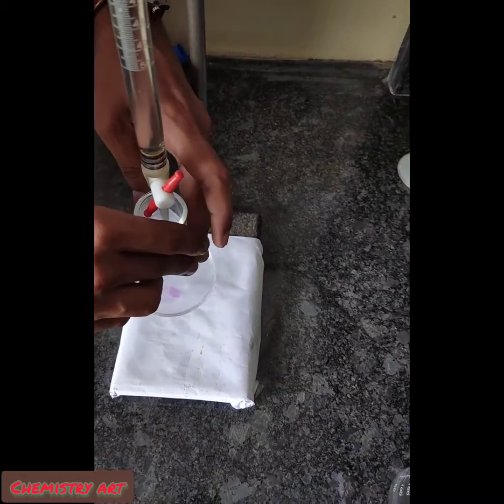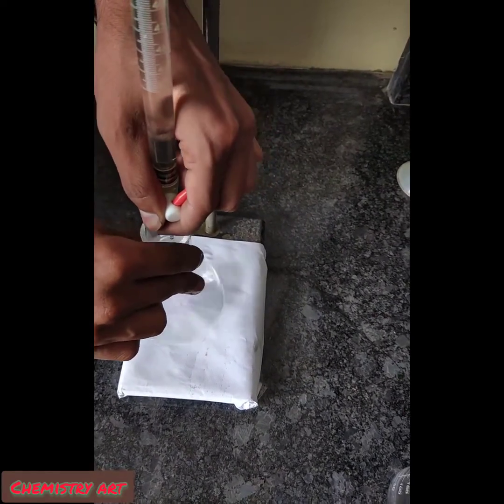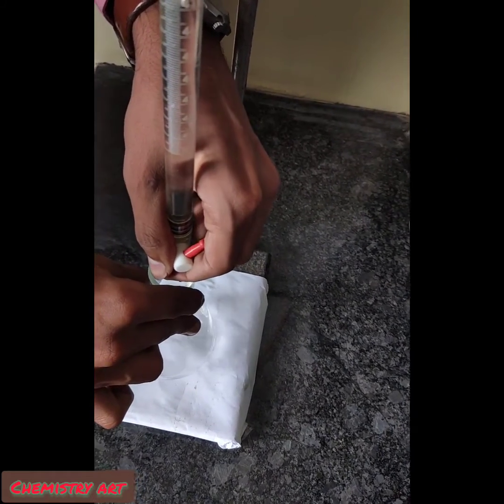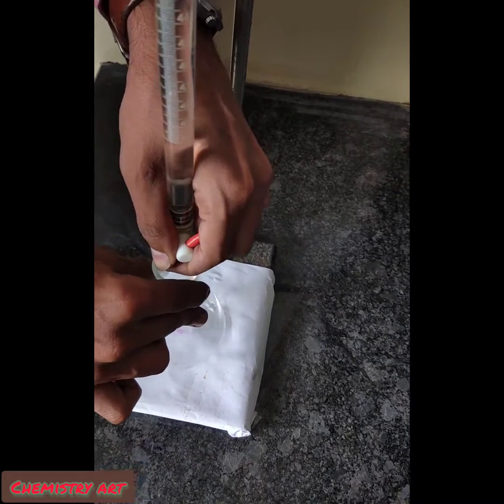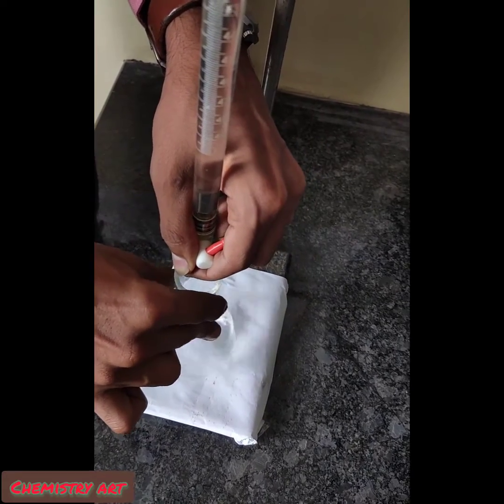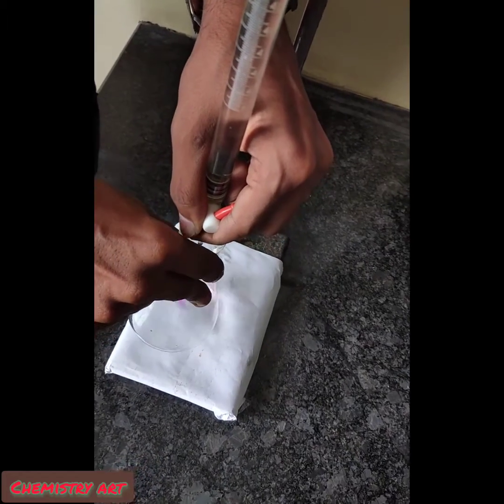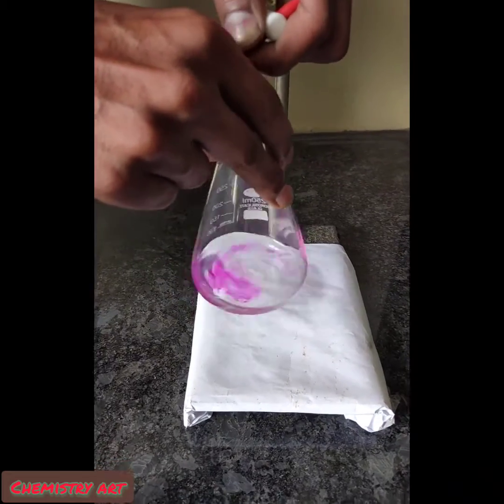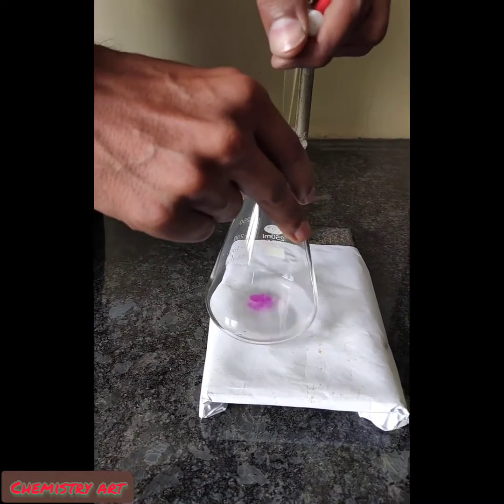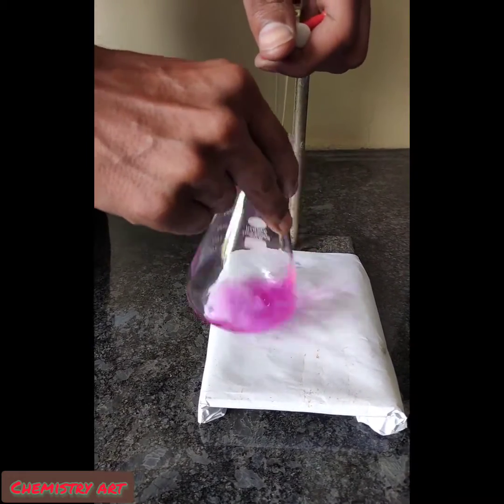When each drop mixes in, it shows a light pink color momentarily but disappears because the solution is still acidic. Now slow down because the stable color may come at any time. The stable light pink color is our endpoint, so be very careful — one more drop could give the continuous pink color.